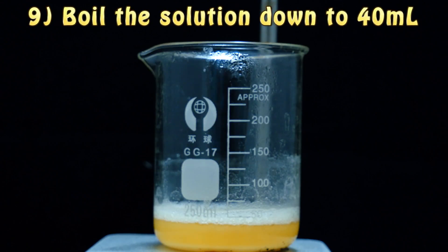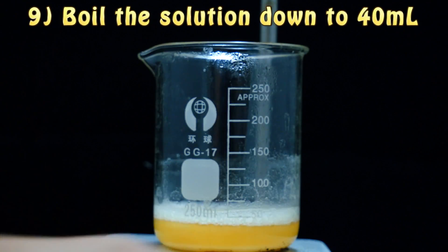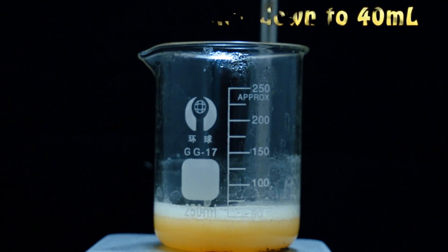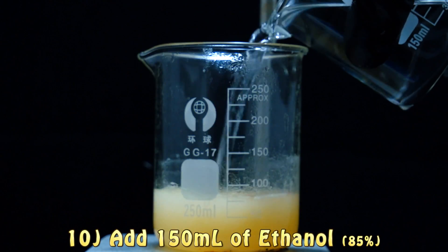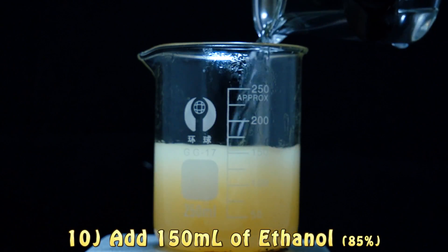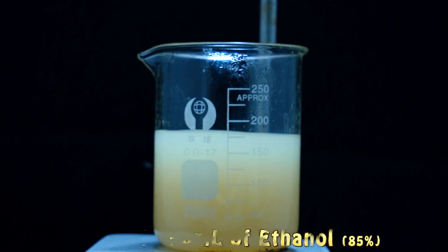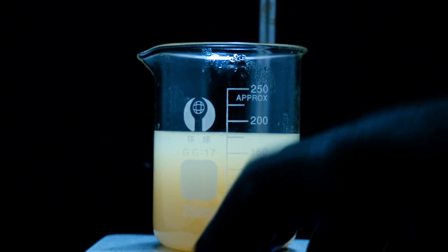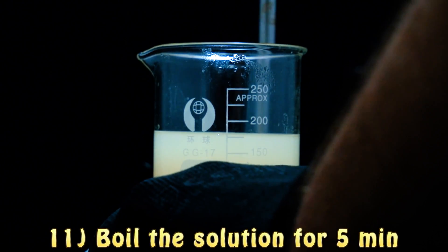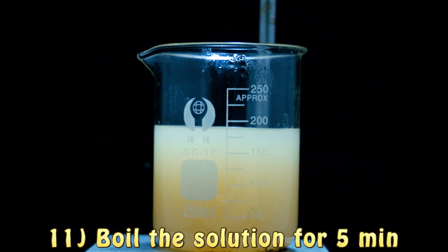Now we are going to boil our solution until it arrives at 40 milliliters. After that we add 150 milliliters of 85% ethanol. Then we heat this solution at its boiling point for about 5 minutes. A precipitate will form, which we filter out, and then continue to experiment with the remaining solution.